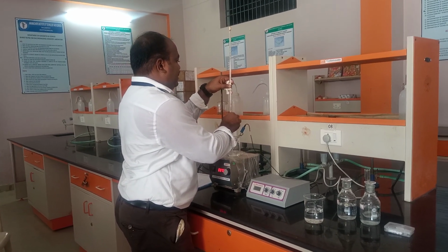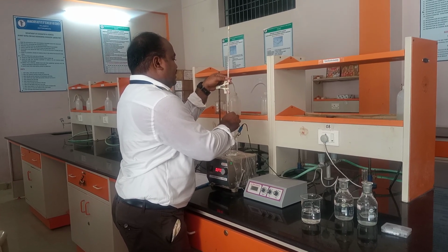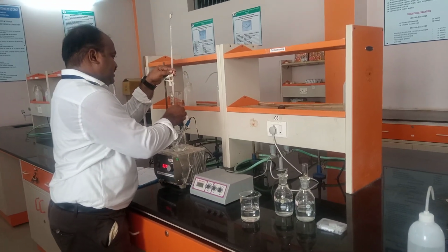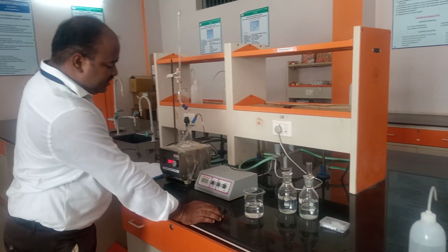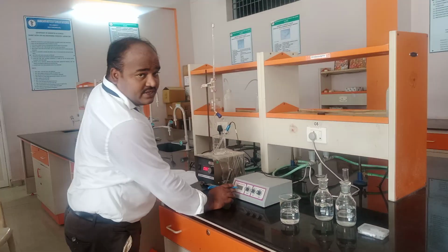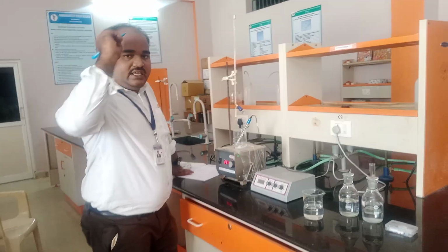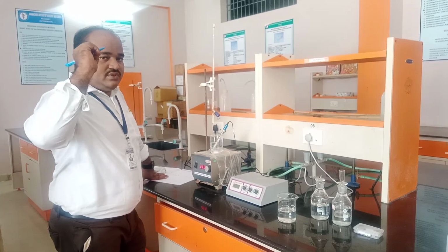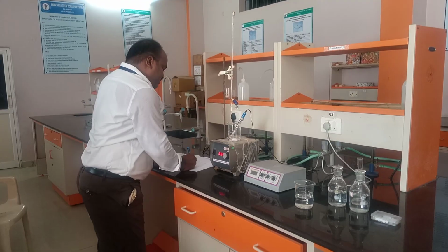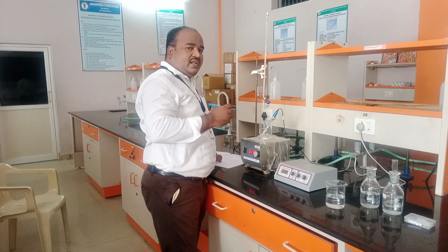0.2 ml. This is a microburette, so you can observe each 0.2 ml very easily. I have added each time. Each time the pH increases, because we are adding NaOH, and it increases slowly. But when it comes to 6 ml, it jumps directly. Then we need to note down the values from 6 to 7 ml. Again we add 0.2 ml for the graph.